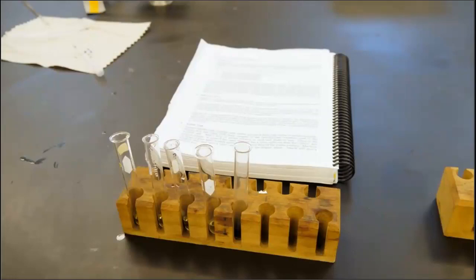And the next test is the Benedict test for detecting carbohydrates. So before proceeding, set up a boiling water bath in a beaker half filled with water, and then add boiling chips to ensure smooth boiling. Any carbohydrate that can form a free aldehyde group in a solution will react with the Benedict reagent to form a brick red, brown, or occasionally yellow precipitate. A precipitate of any of these colors is considered a positive test. However, a color change in the solution without the precipitate is a negative test.